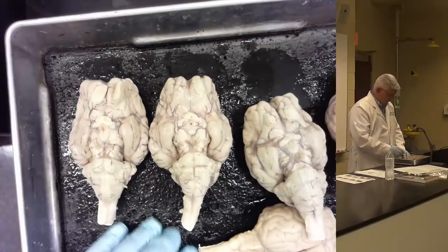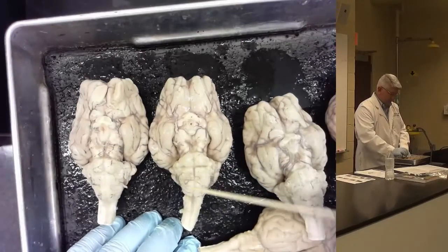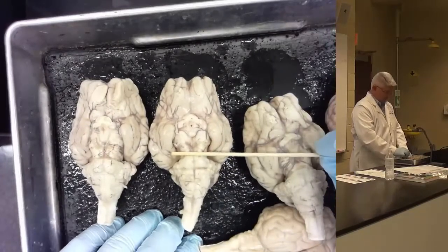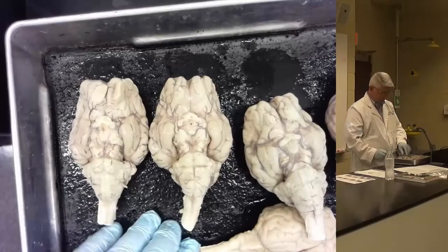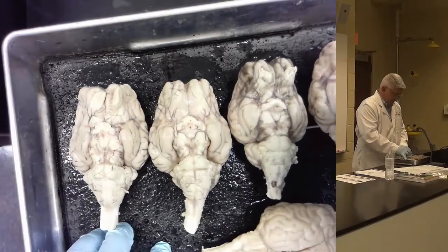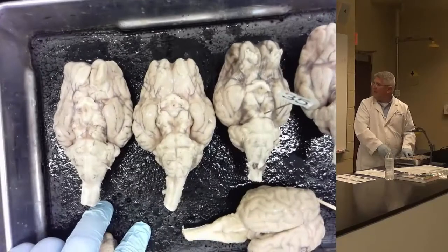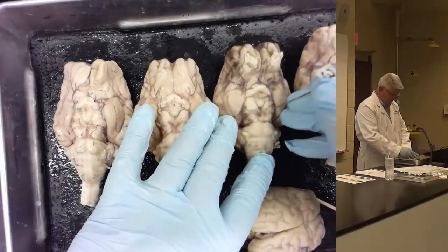Just behind the cerebral peduncles, there's a belt-like structure that sticks out, and that's called the pons. P-O-N-S, pons. So if you were to label the cerebral peduncle, would you put it in the V part? Yeah, I wouldn't put it back here, because that's too close to the pons. I put it up here. I want to be clear, right?